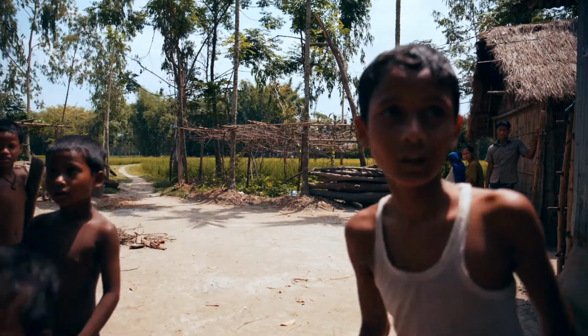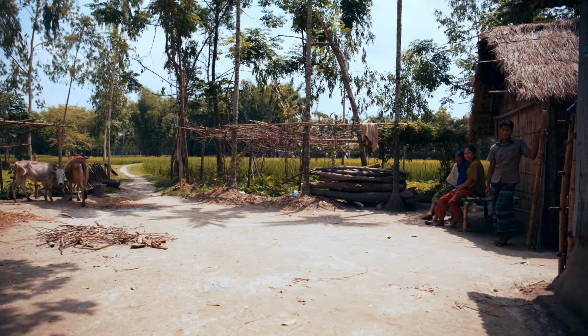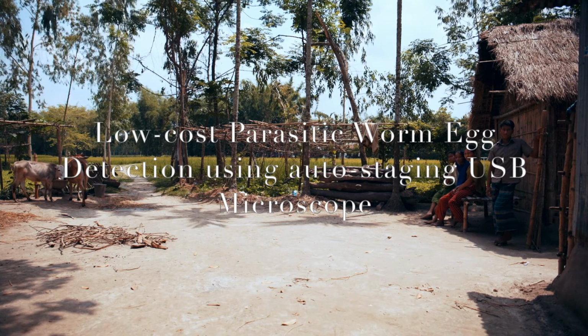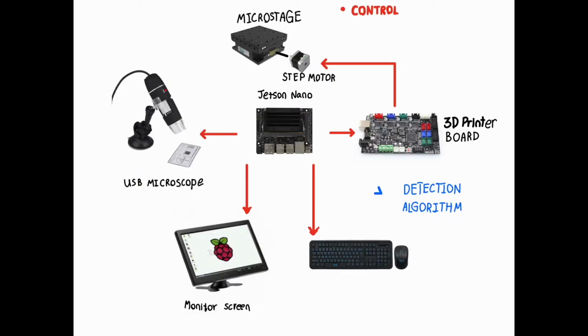Since this disease usually spreads in rural areas where they have no medical profession or financial support, we have constructed a low-cost parasitic worm egg detection using an auto-staging USB microscope to help rural areas solve this problem. There are two sections to construct a microscope set, which are the detection section and the auto-staging section.